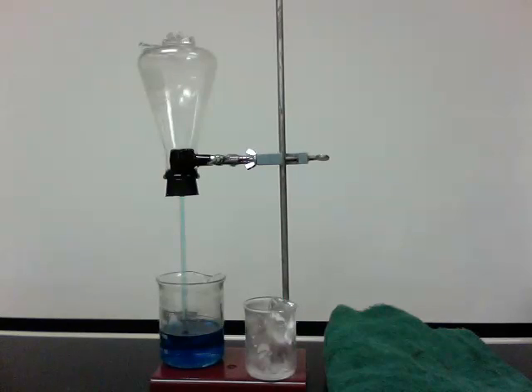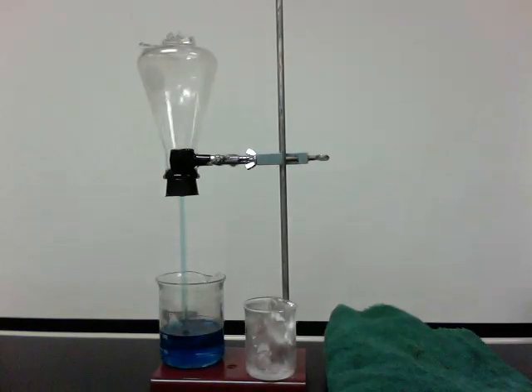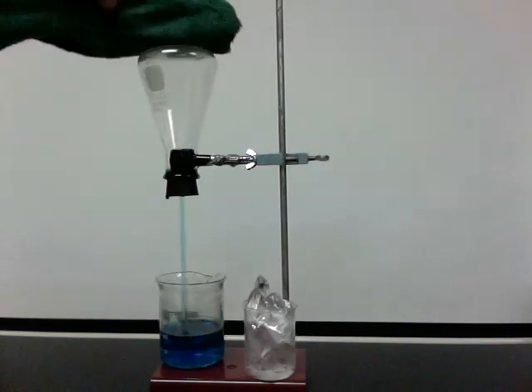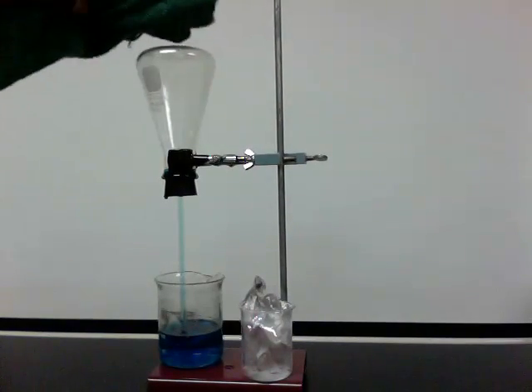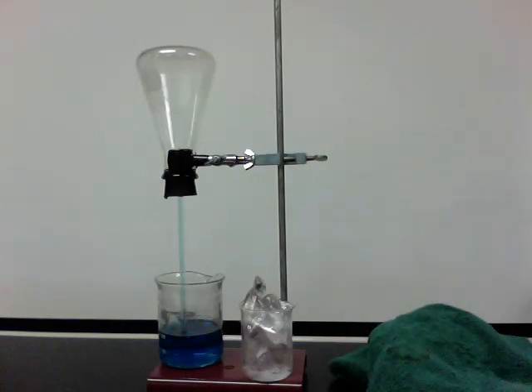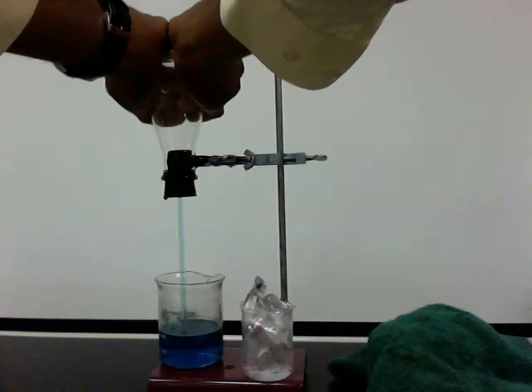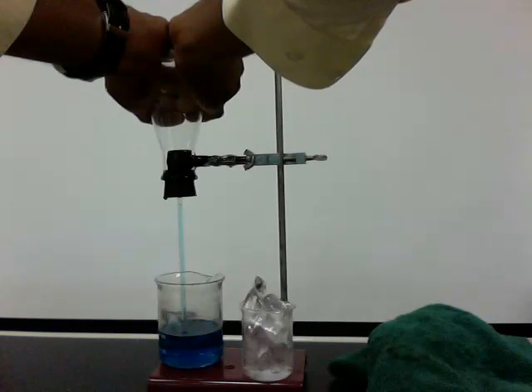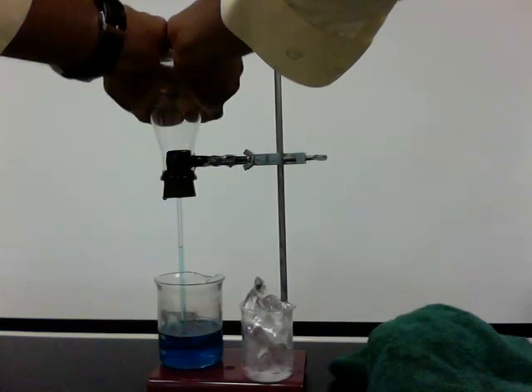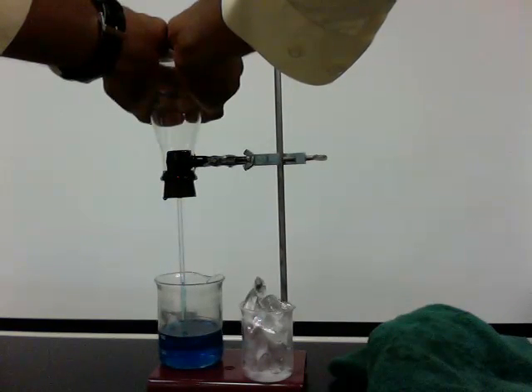Next, we're going to heat the flask — change the temperature of the air inside and see what effect that has. I'll remove the ice and dry it off. My heat source is really just going to be my hands. Think about what the molecules of air are doing inside the flask now and what effect that has. You can see the water is moving down the tube.